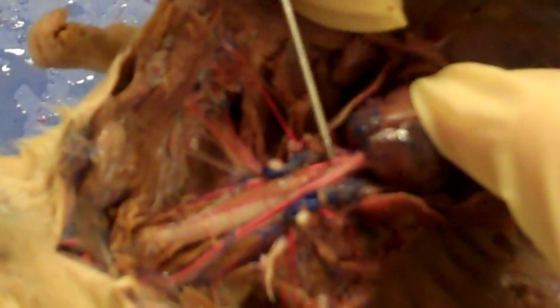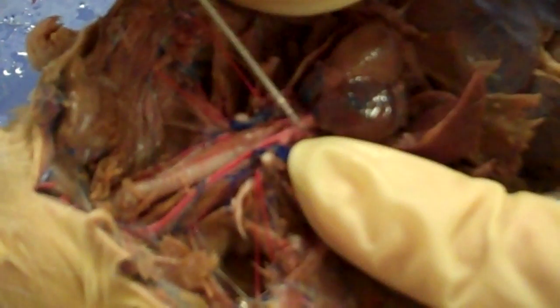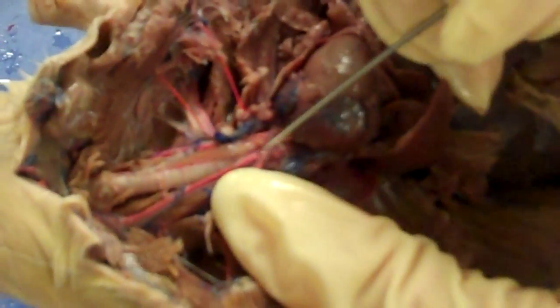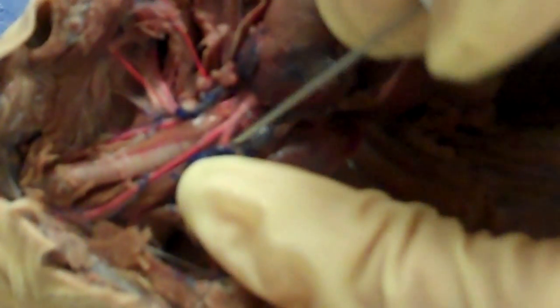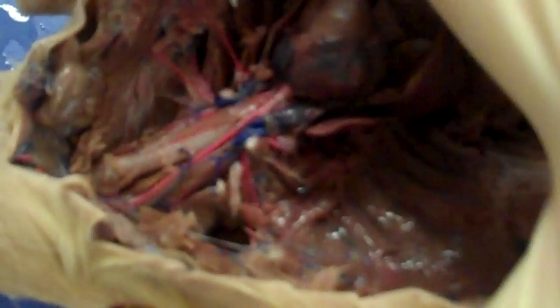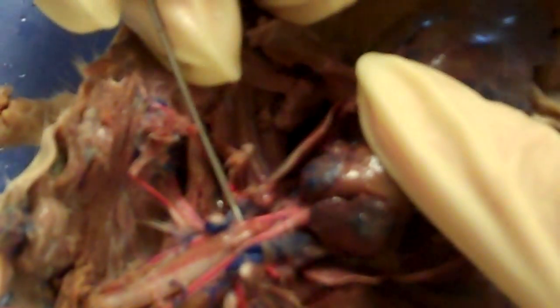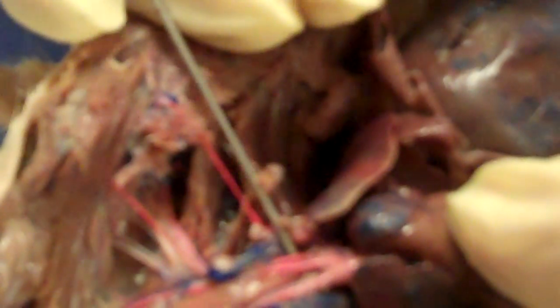I'm going to go through the blood vessels here because these are really pronounced. You can see this is the aortic arch coming out of the heart. The first branch off of the aortic arch is the innominate artery, very short in length. It immediately forks and branches into the right subclavian that goes into the right shoulder, and this is the right common carotid that goes up into the neck. The next branch off of the aortic arch is the left common carotid that goes up to the left side of the neck. And the last branch over here is the left subclavian that goes into the left shoulder.